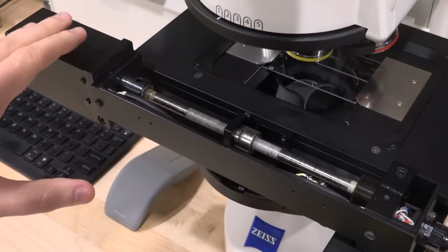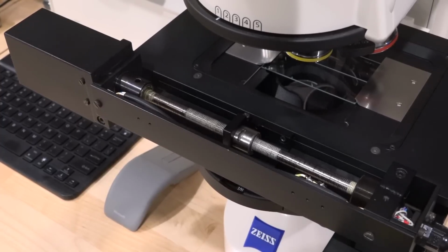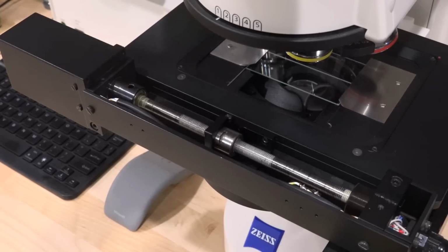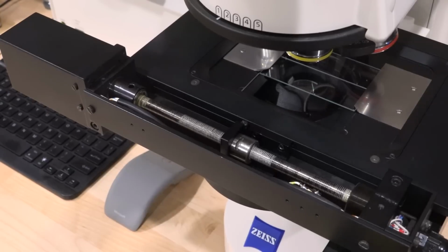Now, all the PID controller part of this is inside the MCU28 box. So we'll have to take a look at that too, because that also has some issues before I could get it repaired. And you can see the other axis movement. So the entire structure moves this way, and then the intersection moves that way. And the slide can be put in there in the middle, and everything has to be balanced, of course, otherwise you go out of focus.